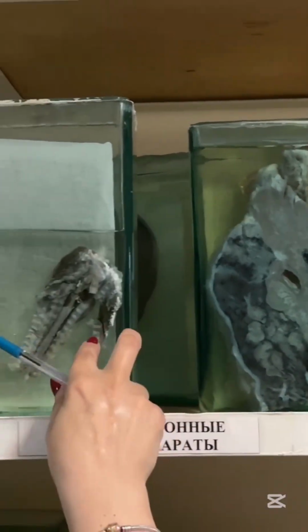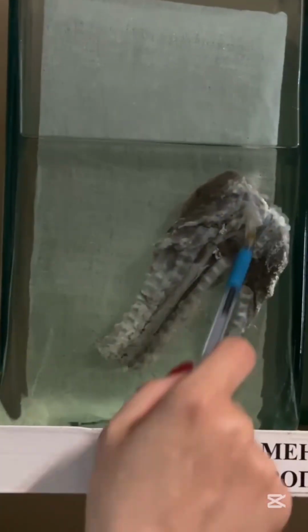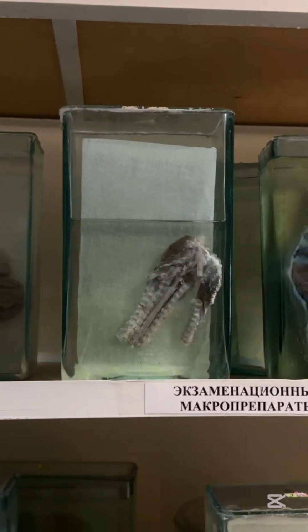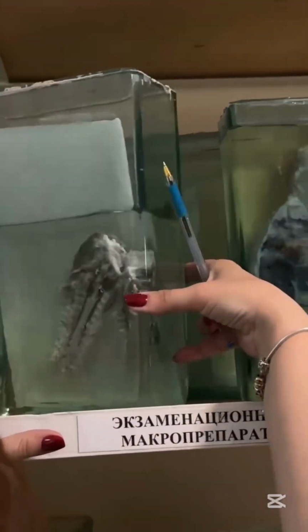This one, I think it's also absent, it is from today's class, that is rupture of spinal cord during delivery, trauma, due to traction of the baby.